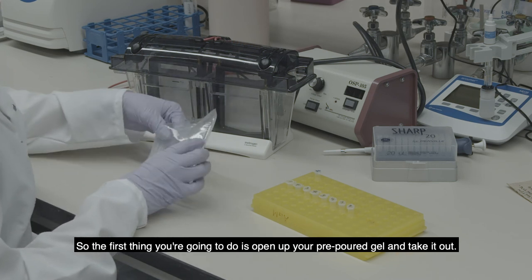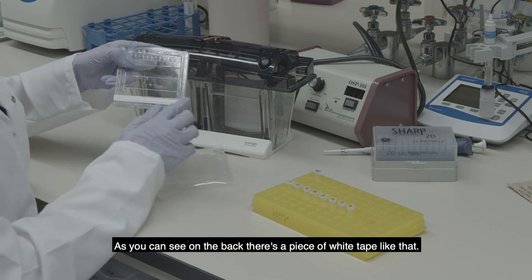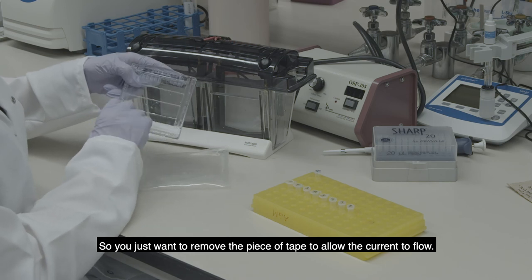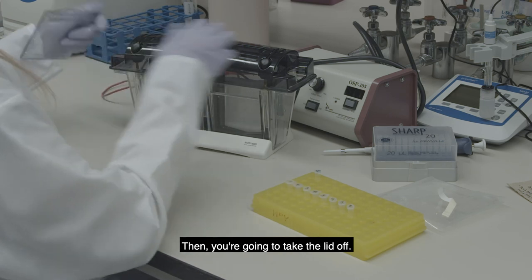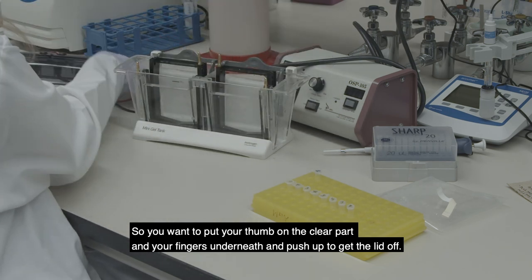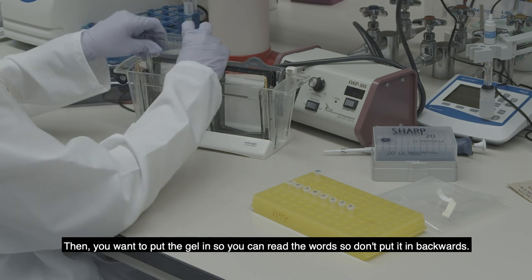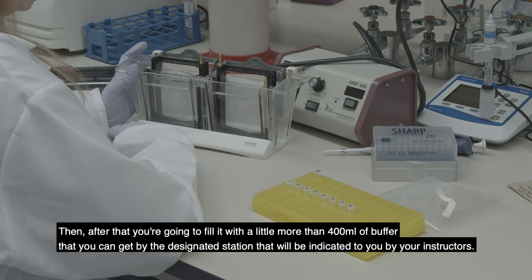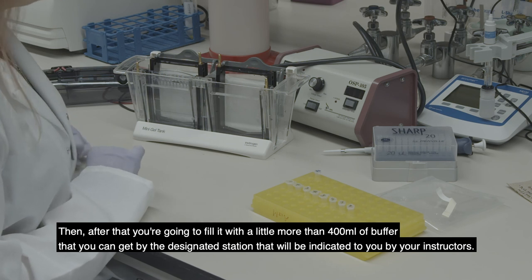The first thing you're going to do is open your pre-poured gel and take it out. On the back you can see a piece of white tape — remove that piece of tape to allow the current to flow. Then take the lid off by putting your thumb on the clear part and your fingers underneath and pushing up. Put the gel in so you can read the words — don't put it in backwards — and push it in between the two black pieces. After that, fill it with a little more than 400 milliliters of buffer from the designated station as indicated by your instructors.